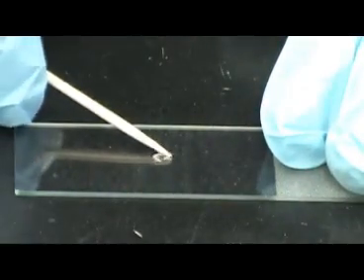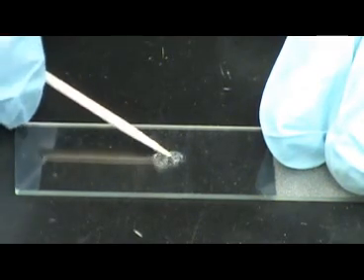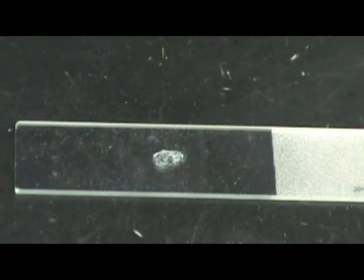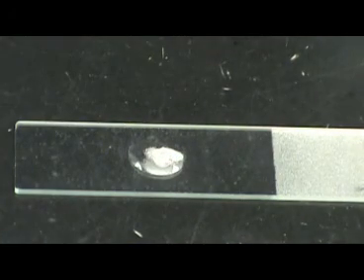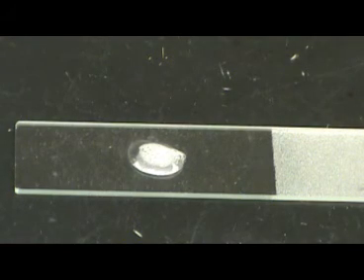When placing the bacteria onto the slide, it is important to lyse or rupture some of the cells to expose catalase to the hydrogen peroxide. Hydrogen peroxide will be converted by catalase into oxygen gas and water. The presence of bubbles indicates oxygen gas, so this organism is catalase positive.